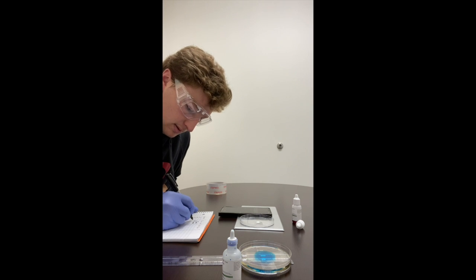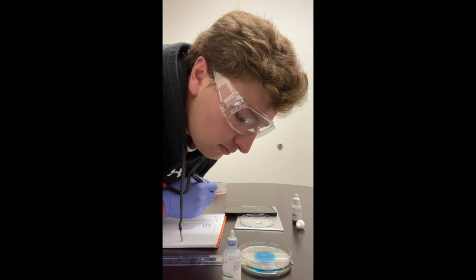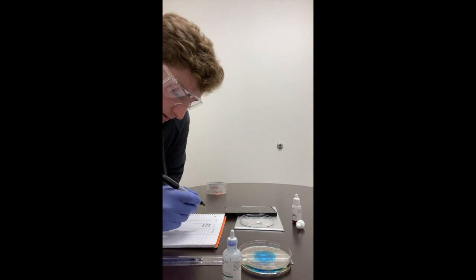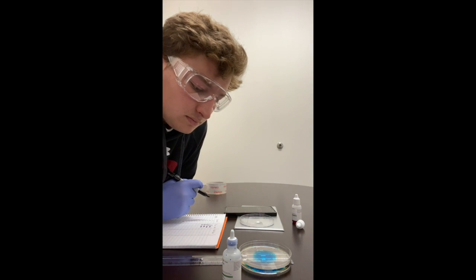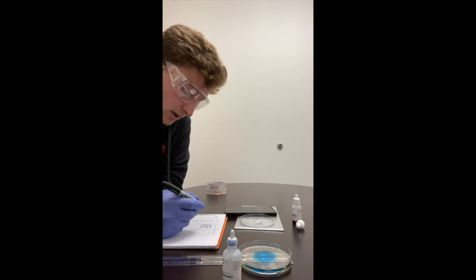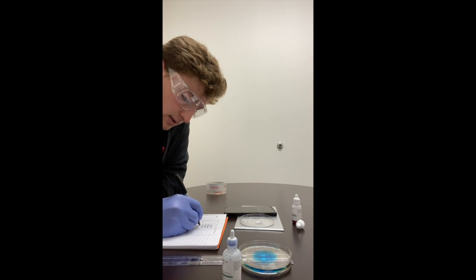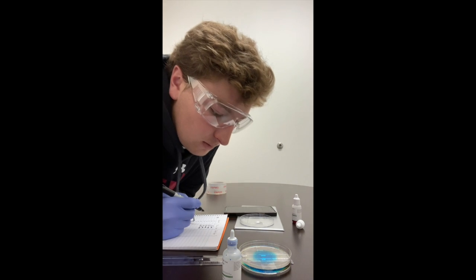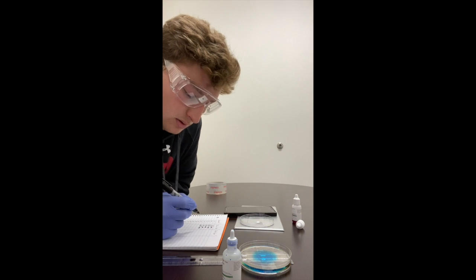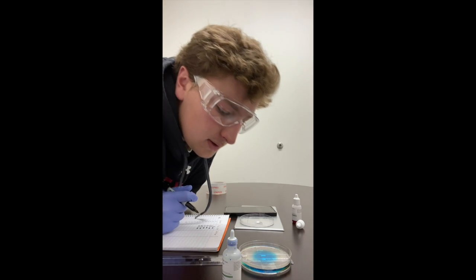At 30 seconds it is 6 centimeters. 40 seconds, 6 centimeters. 50 seconds, it is 6.5 centimeters. And 60 seconds, it is 6.5 centimeters. So it stopped moving, it looks like.